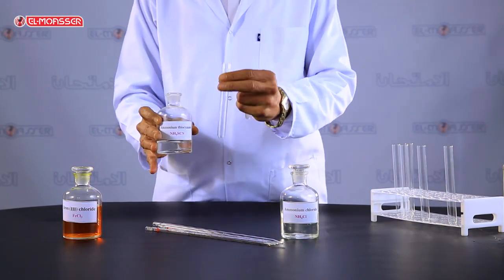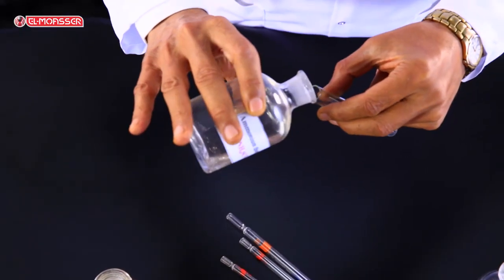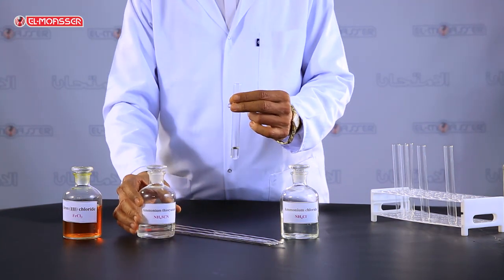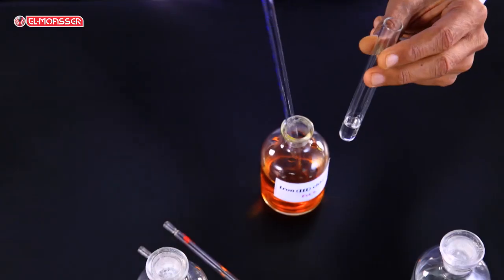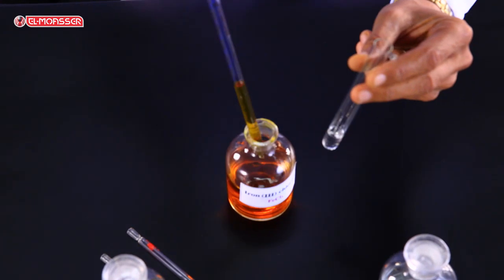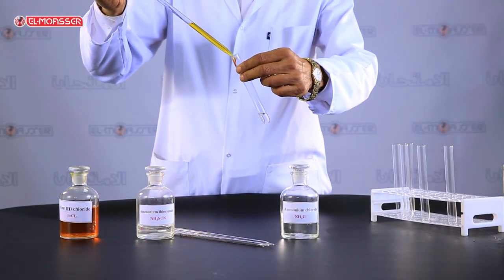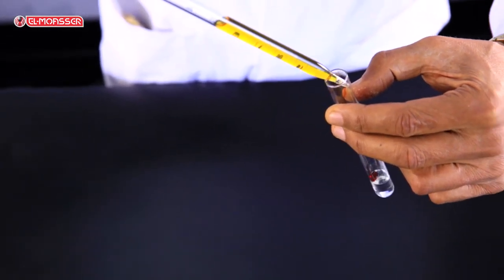Place a small amount of ammonium thiocyanate solution in a clean test tube. A pipette is used to transfer an amount of iron(III) chloride solution, which is then added to the ammonium thiocyanate solution drop by drop.